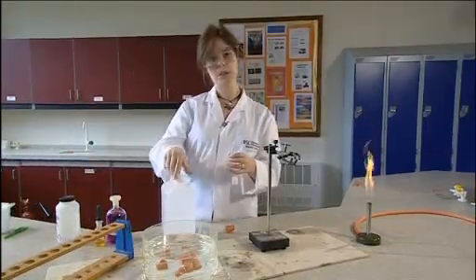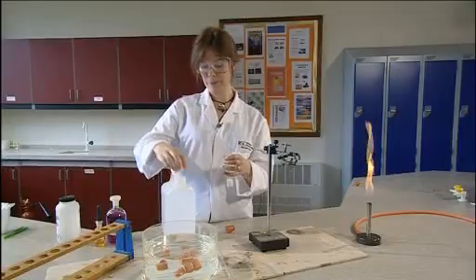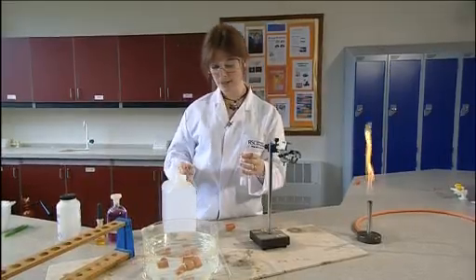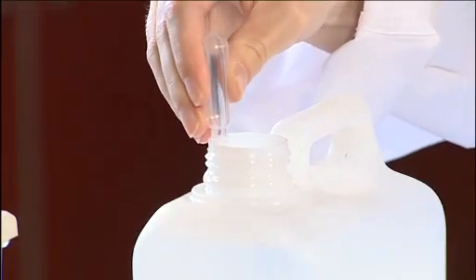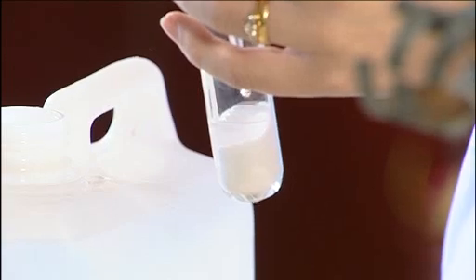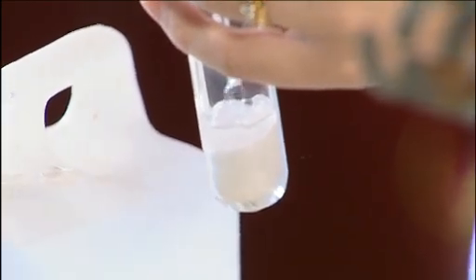The initial source of alkanes is liquid paraffin which has about 20 carbons in its chain length. Use a dropping pipette to add liquid paraffin so that it soaks into the mineral wool. You'll need about two centimetre cubed.